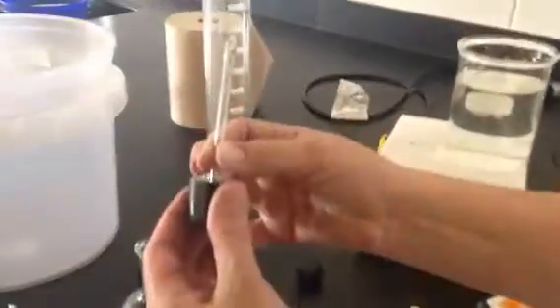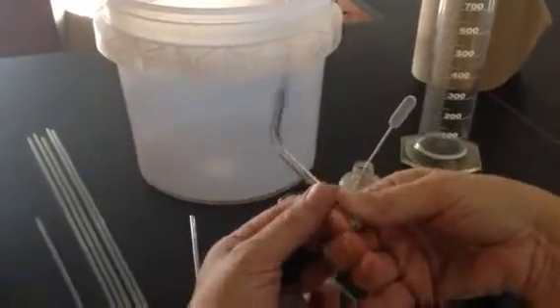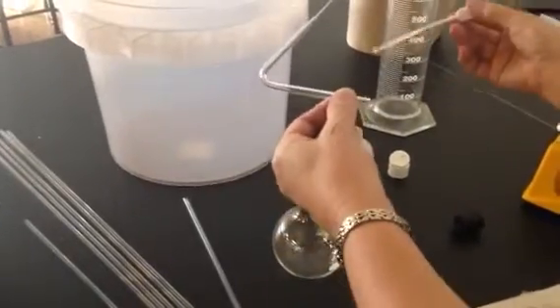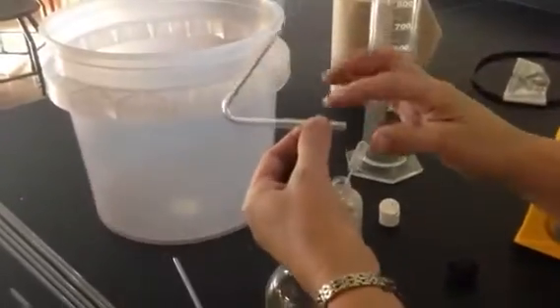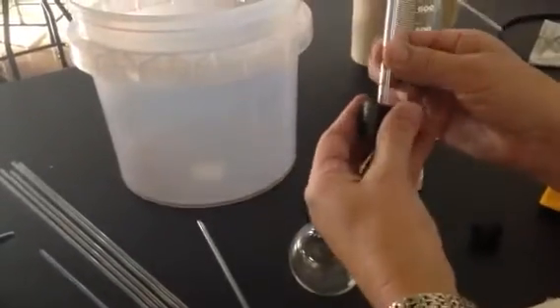And I want to get then this end through this one-hole stopper. It doesn't fit very well, so I put a little tiny bit of glycerin on the outside and kind of roll it around with my finger. So I just have a little bit, not a lot.